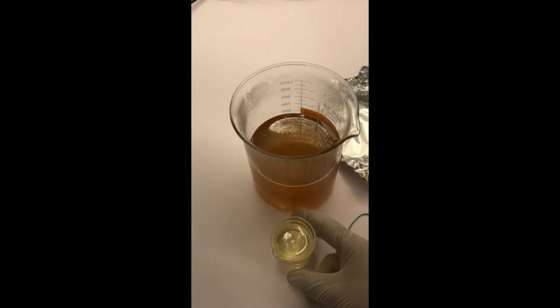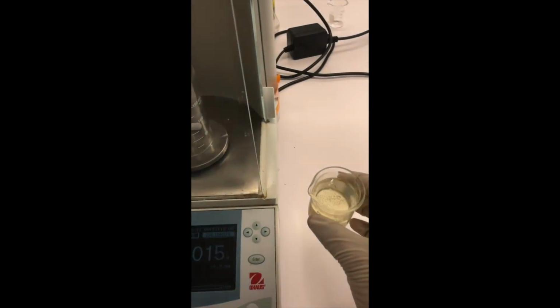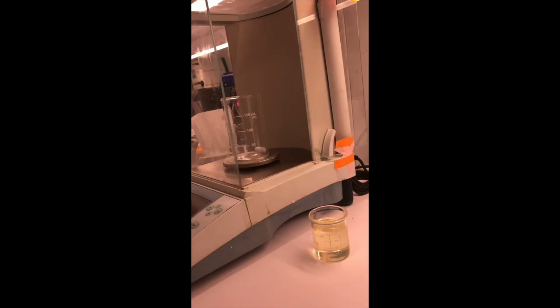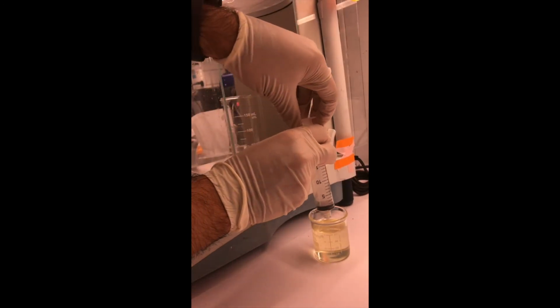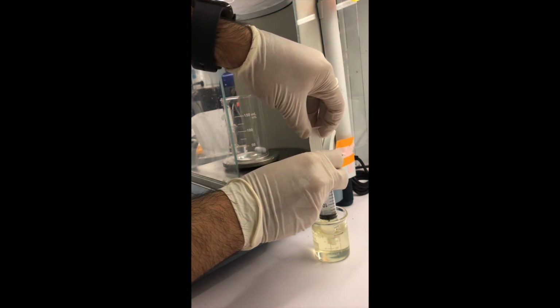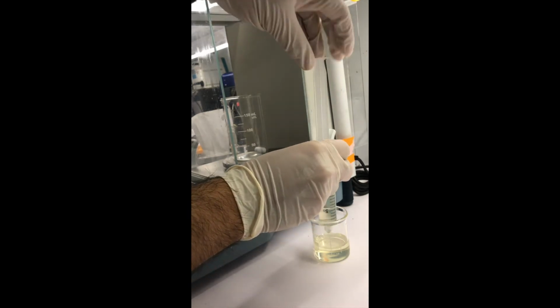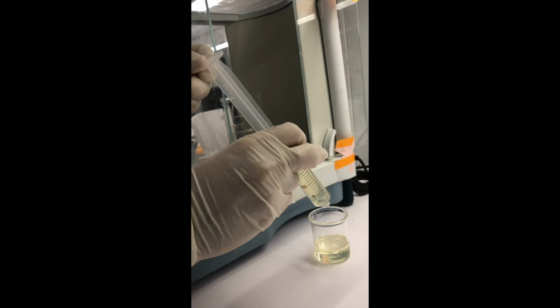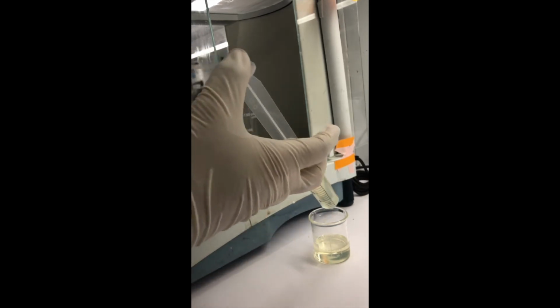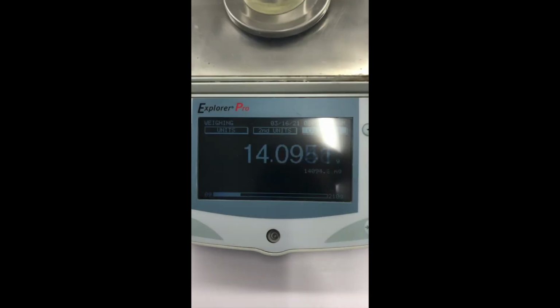So here I just grabbed a little bit of that purified oil. Basically, even that's too much, more than I'm going to need, but I'm just going to bring it to the analytical balance. And then I'm going to use a sterilized syringe so that I can accurately, or at least somewhat accurately, add the oil to my sample. So here I'm just drawing up some of that purified oil, making sure there's no air bubbles, and then making sure there's nothing dripping off the side because I don't want to dirty my space. And then I'm just going to add it into the sample slowly because I don't want to create any unnecessary air.